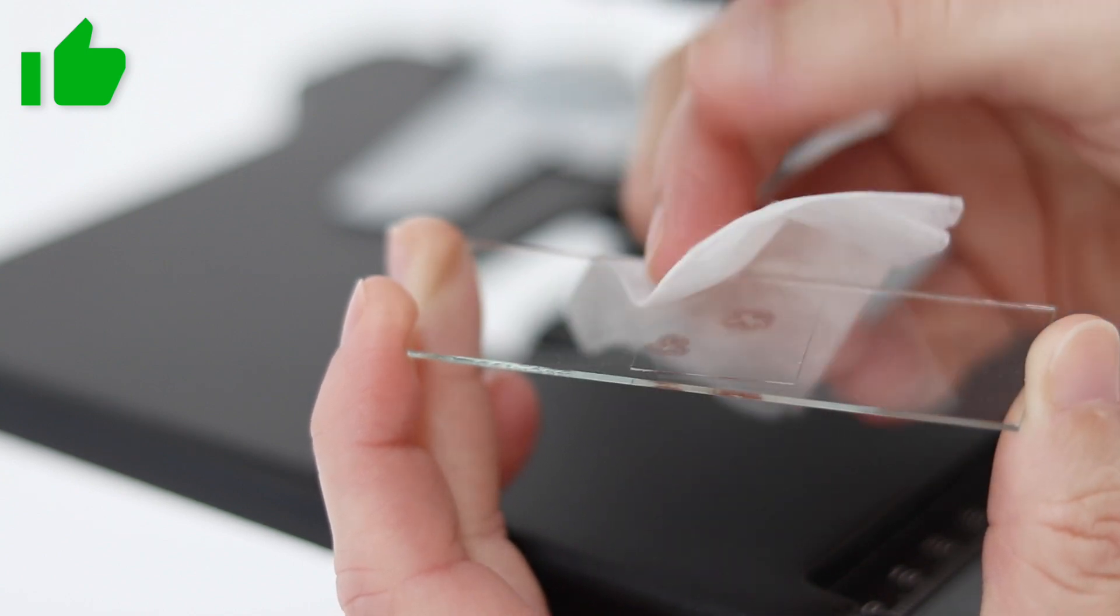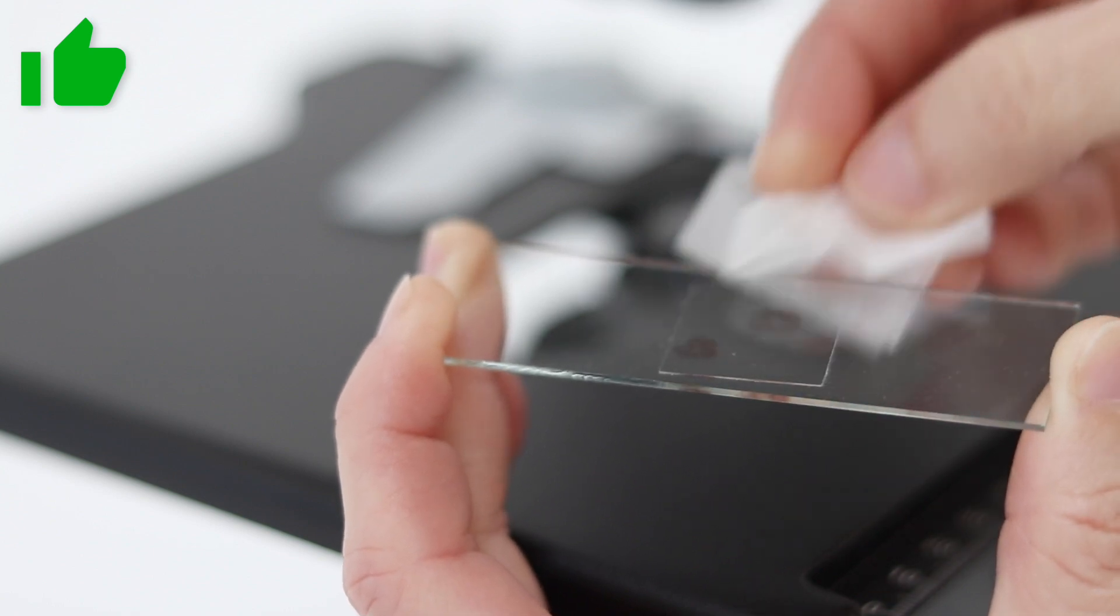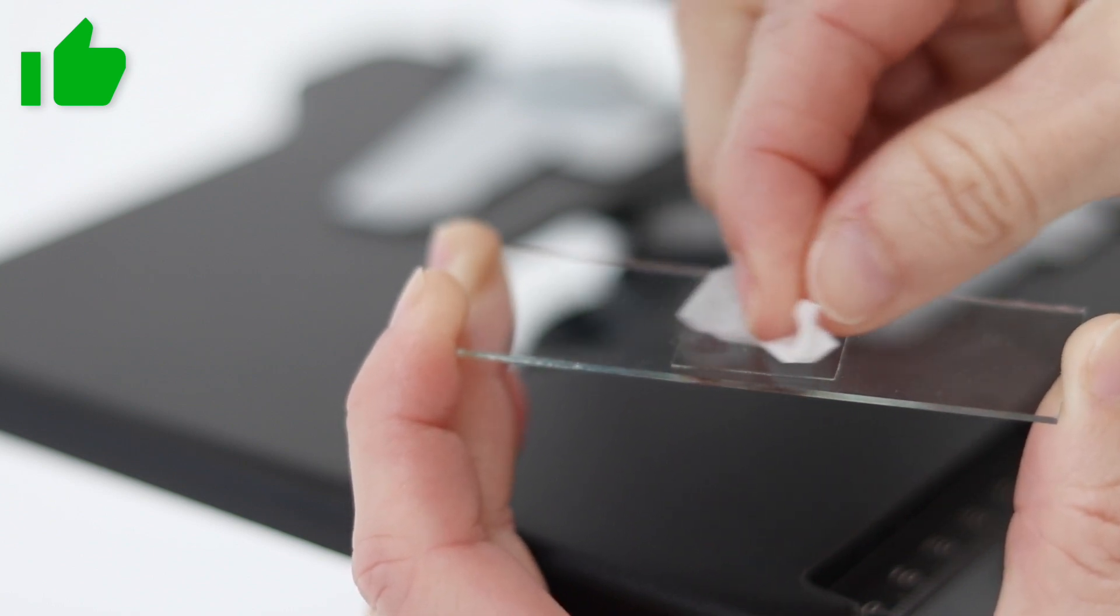By doing this, any potential damage to other objectives, especially the ones of high magnification such as 40, 50 or 60 will be avoided.